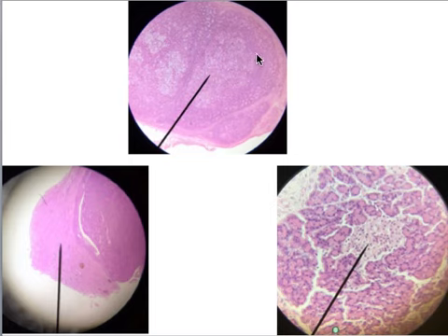Up here we have the adrenal gland. If you look real close, you can see that the exterior portion right here is the cortex, and it has a couple layers to it. And then this interior portion right here is the medulla.